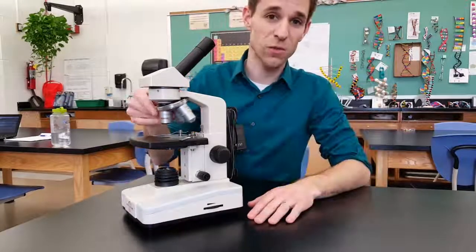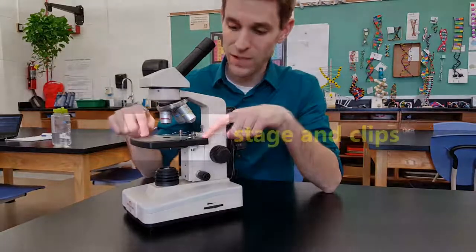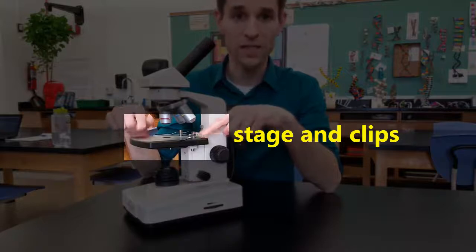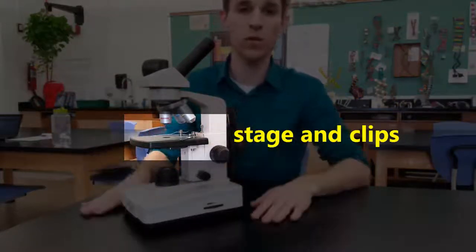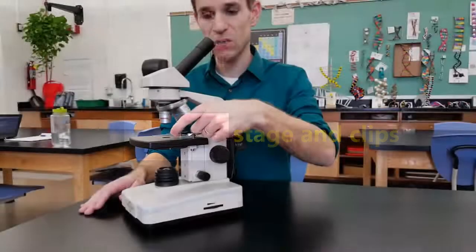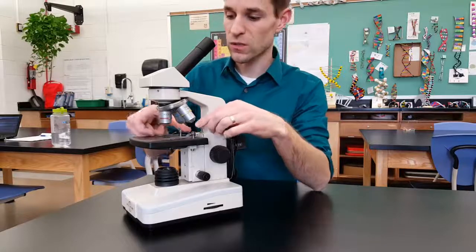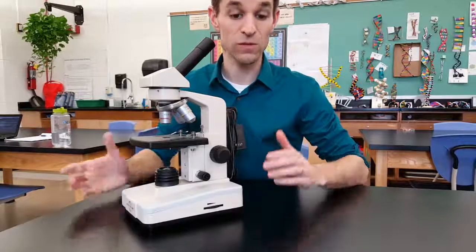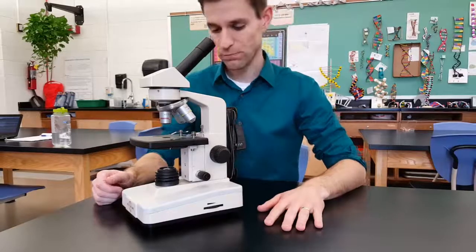I'm going to rotate this back to the red lens because we always start with the red lens. The black stage here is where you place your glass slide with your specimen — this is called the stage. The stage goes up and down in order to focus your specimen. We have stage clips here in case you want to keep a glass slide from moving — you can use these little steel clips to clip it in place, so if you did move the scope, your specimen won't move hardly at all.